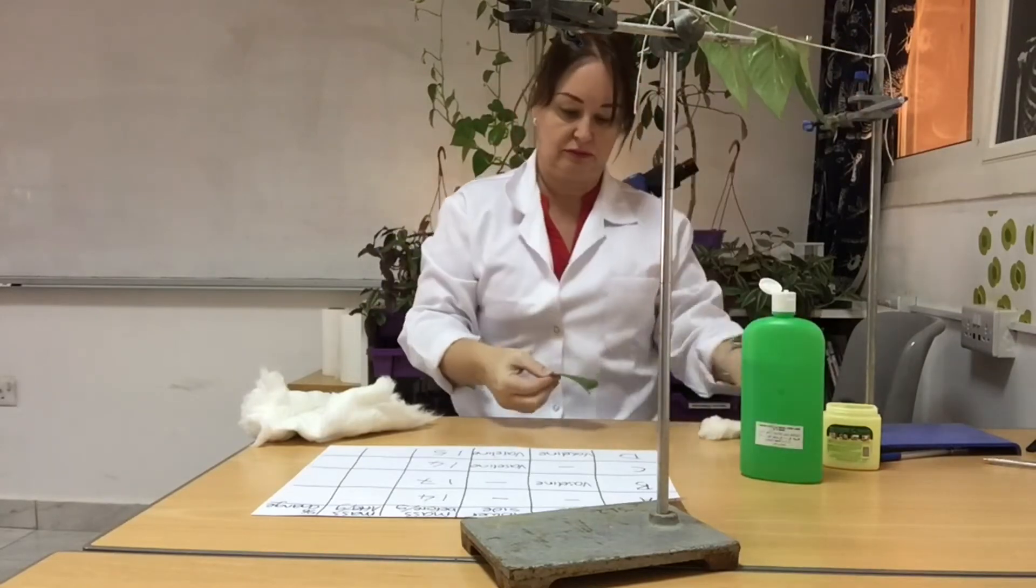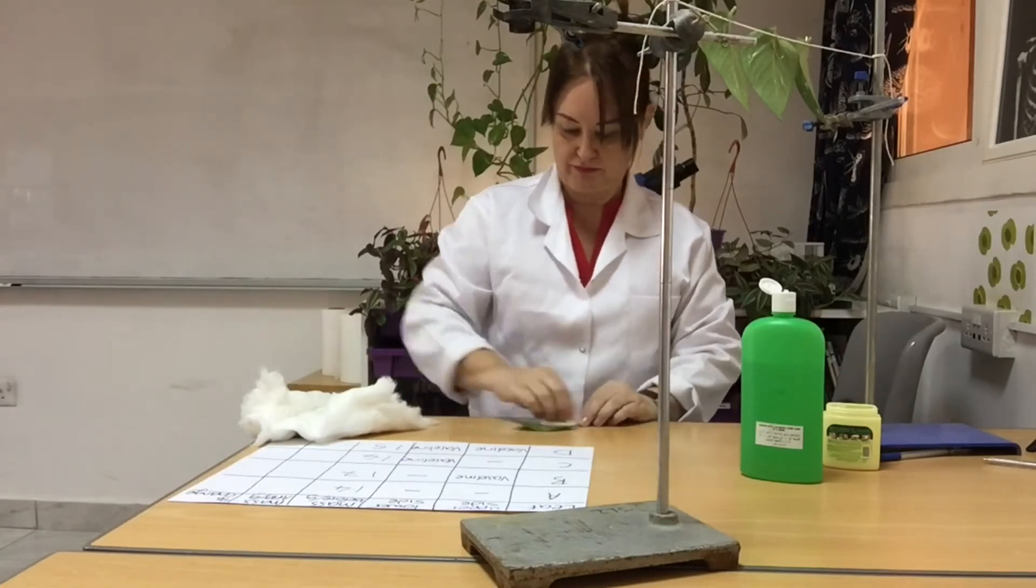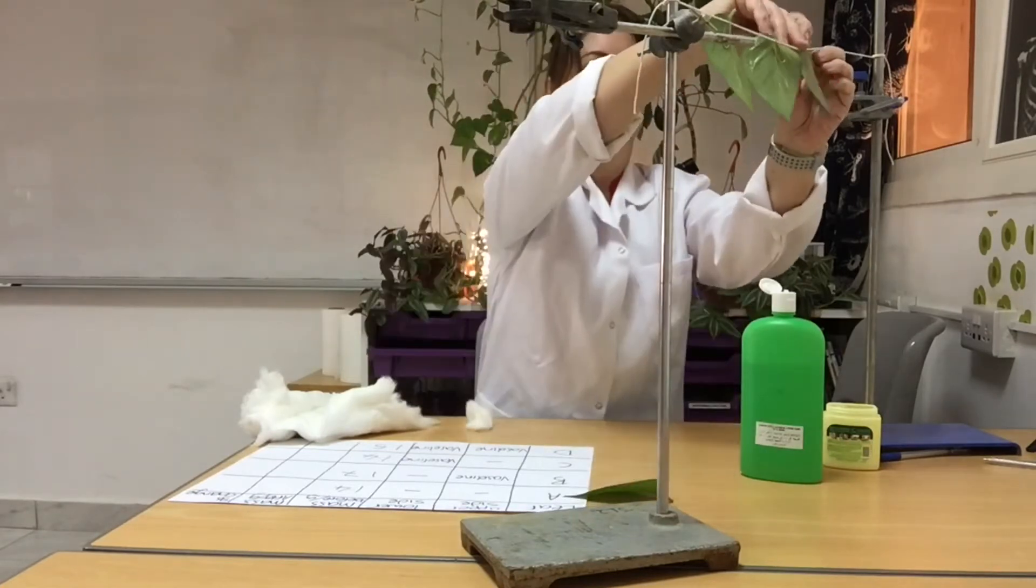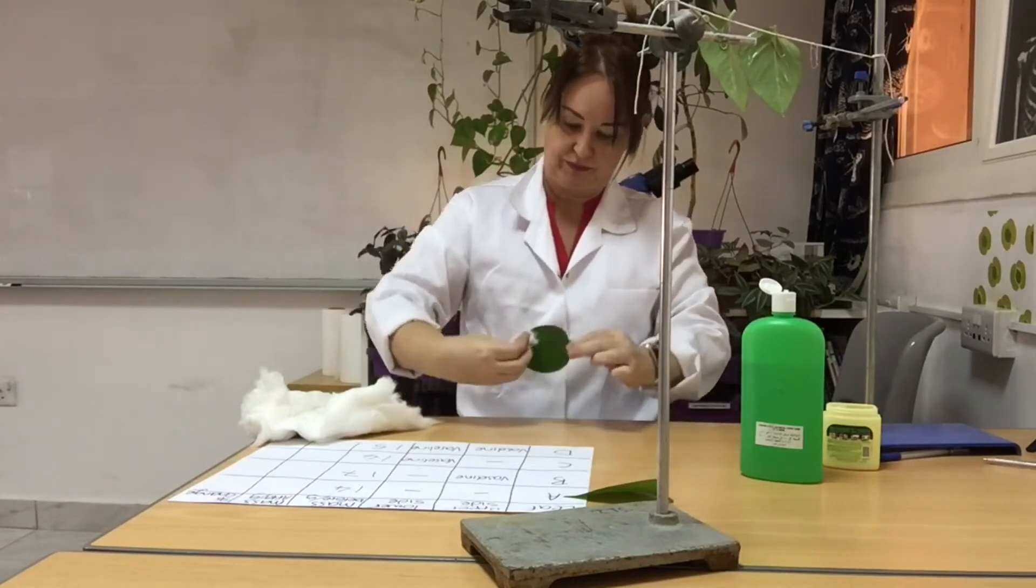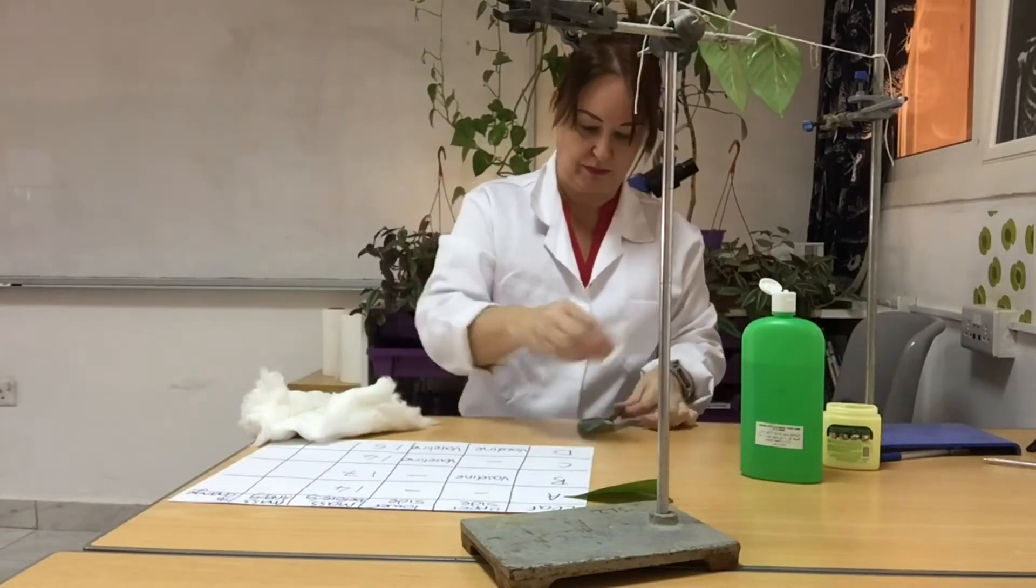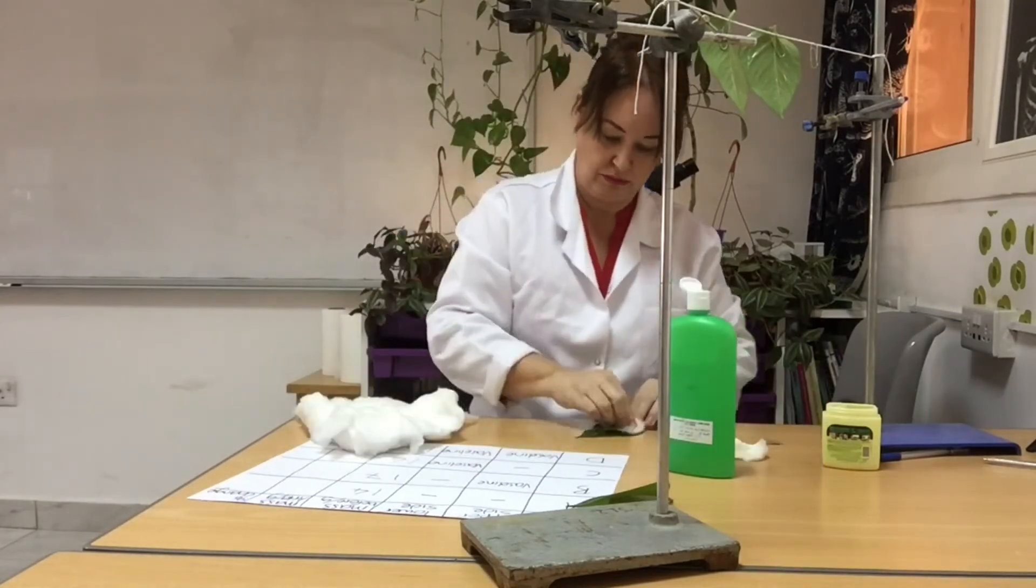I've left them for 24 hours. However, before I weigh them, I need to remove the Vaseline because that will have added some mass. Vaseline is petroleum jelly and won't be removed with water—I'm going to have to use a solvent. Here I'm using an alcohol.